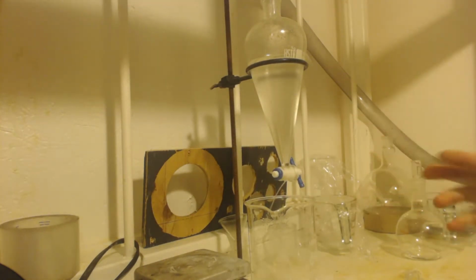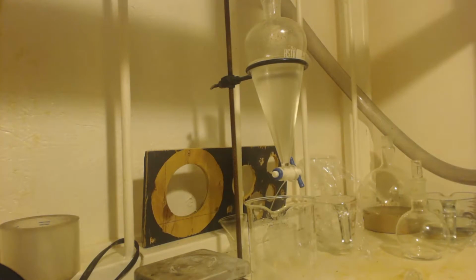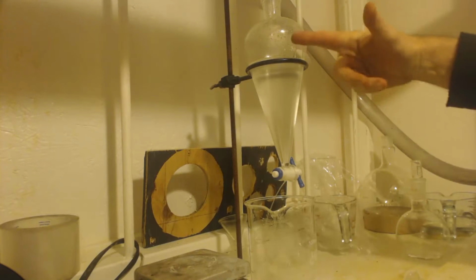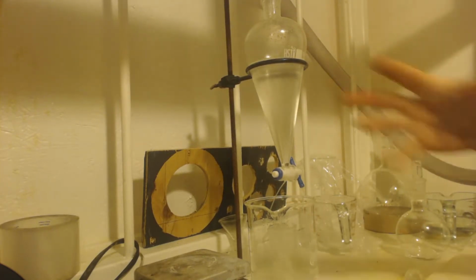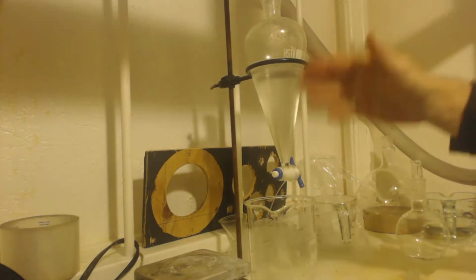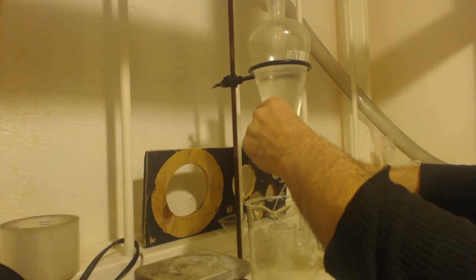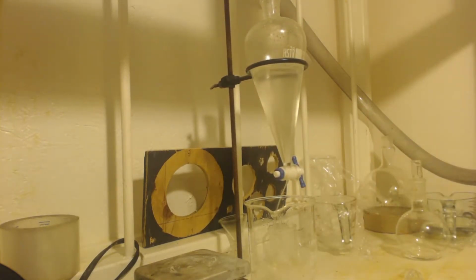Okay, now basically what we're doing here, right? You got a polar solvent, the water, and you got a non-polar or slightly polar, so slight that you can call it non-polar, diethyl ether, okay? So we have the propionic acid right now. That's soluble in both water and the diethyl ether. So we threw some salt in there, right? And the salt made it push the propionic acid into the ether better. You know what I mean? That's why we put the salt in. Okay.